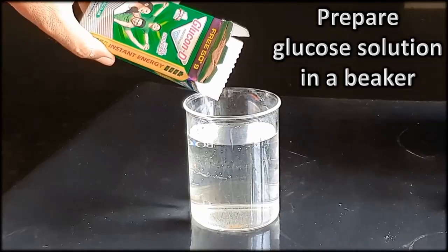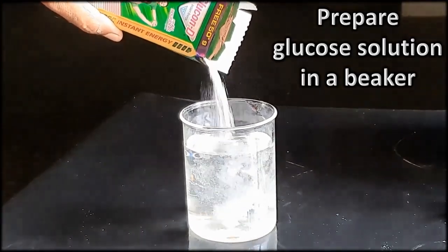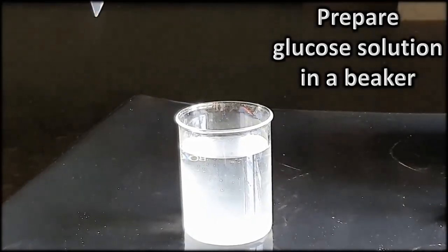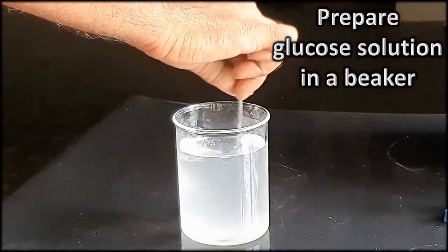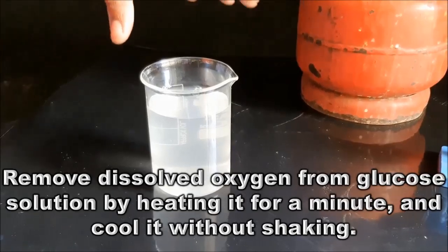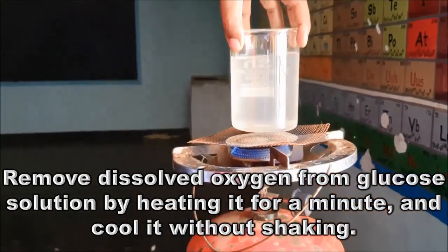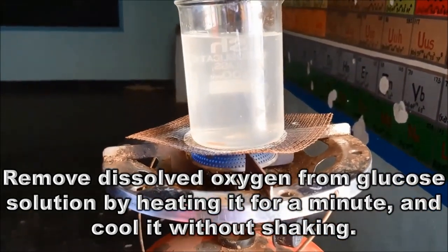Prepare glucose solution in a beaker. Take fresh water in a beaker, add glucose powder into it and stir it with the help of a rod so that the glucose will be completely dissolved in the water. Remove the dissolved oxygen from the glucose solution by heating it for a minute and cool it without shaking.